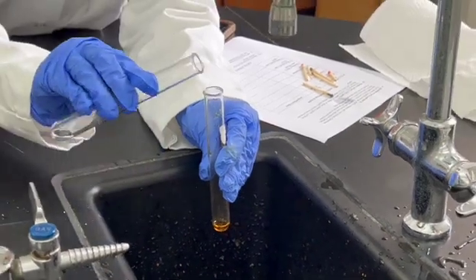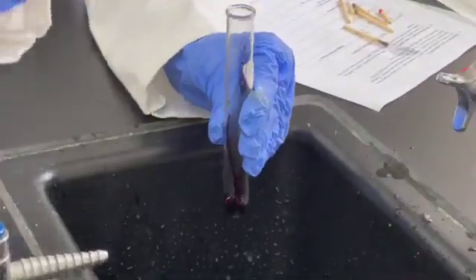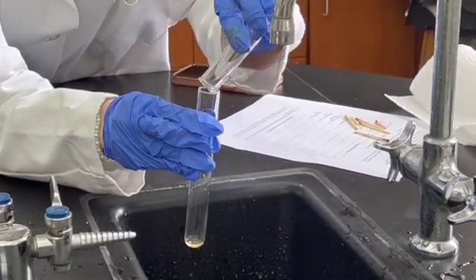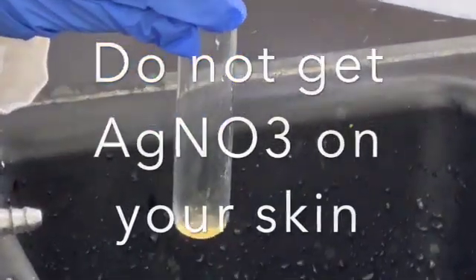To 5 drops of iron(III) chloride solution, add 1 to 3 drops of potassium thiocyanate. Observe and record your observation. To 5 drops of FeCl3 solution, add 1 to 2 drops of AgNO3 solution. Observe and record your observations and fill out the table and questions on your lab sheet.